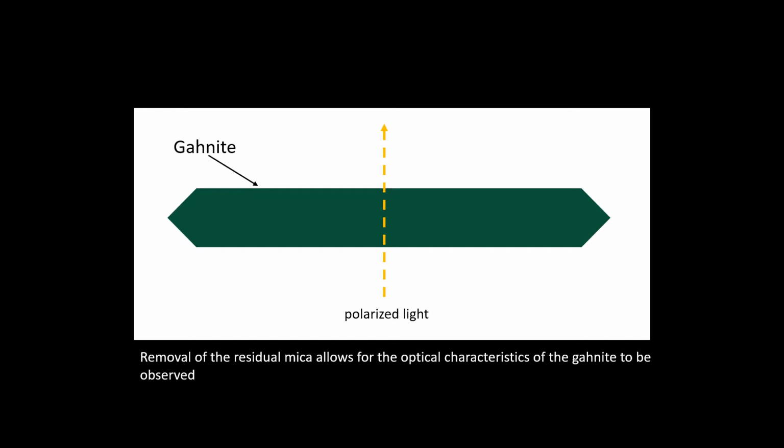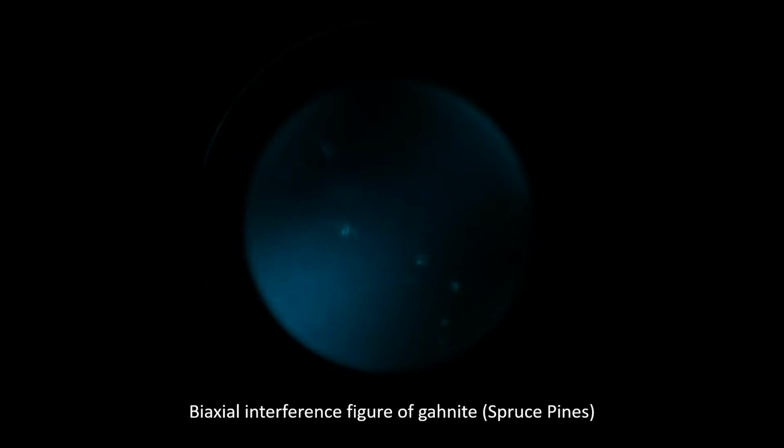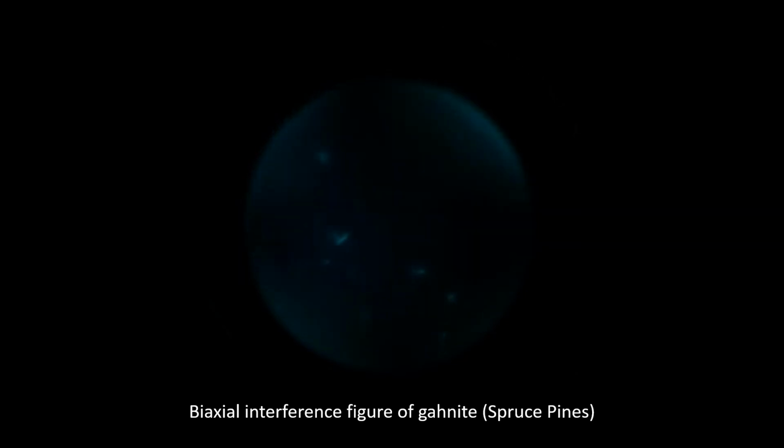Removing the residual mica allowed for the optical characteristics of the gahnite to be observed, and in doing so, this is the interference figure that we saw. While it's certainly much darker and nowhere near as clear as the first one, it is still distinctly biaxial. You can see the isogyres moving around.